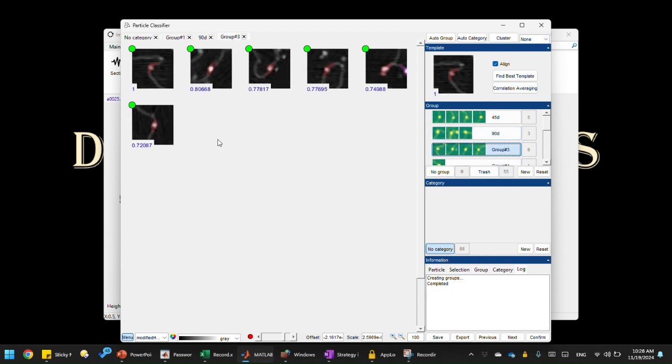Now this is more like a low bend state, right? Yeah, I think it's probably a little bit smaller than 45 degree. Yeah, maybe 30 to 45 degrees, close to unbent state. Yeah, I think it does a pretty good job in getting the particle classes.